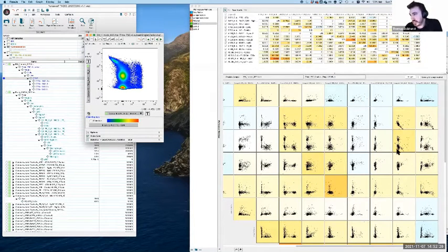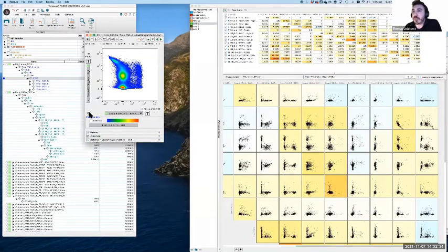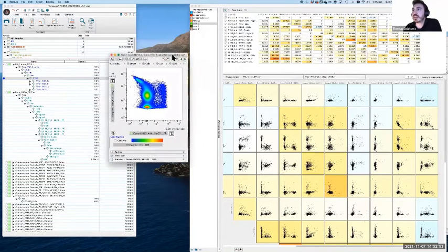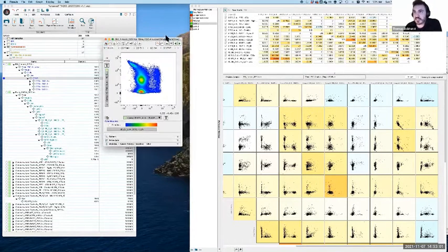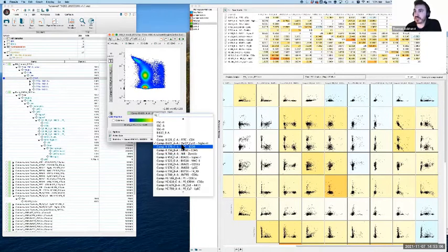There is actually another detector which is going to have issues as well, which we'll see in just a moment if I open it up. So ironically, PE-Cy7 is causing problems in the PerCP-Cy5.5 detector, but it's not only that detector, it's also in PE-Cy5. So these are 2 separate problems in this example, occurring independently. So we're just going to deal with one at a time. It's definitely easier to deal with things in a methodical process, one at a time. Otherwise, it's very easy to get lost. So this is our problem at the moment: the contribution of PE-Cy7 into the PerCP-Cy5.5 detector.